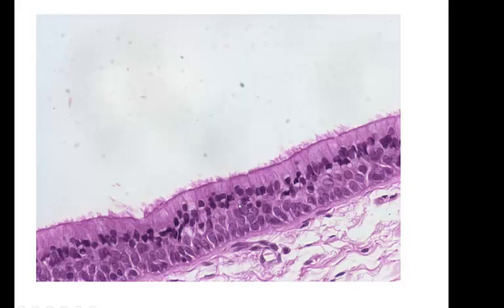And so this part of the mucous membrane, the underlying connective tissue, would be called the lamina propria. And the type of connective tissue associated with lamina propria would be areolar connective tissue. So this is areolar connective tissue down here supporting our pseudostratified ciliated columnar epithelium up here. It looks like many different rows, but again, this is pseudostratification. This is false layering.